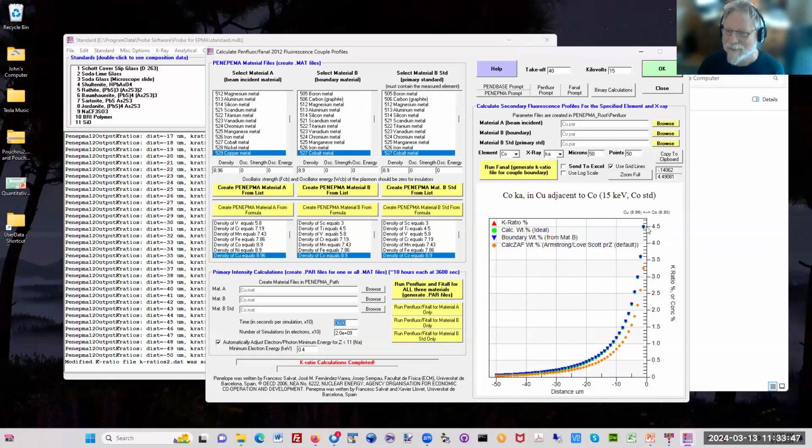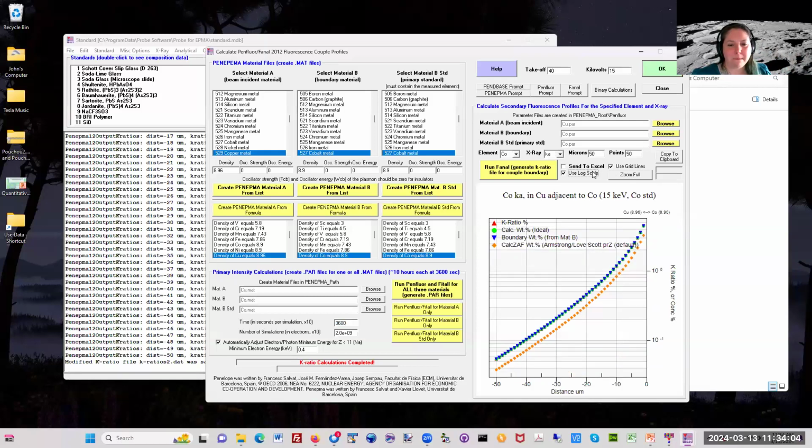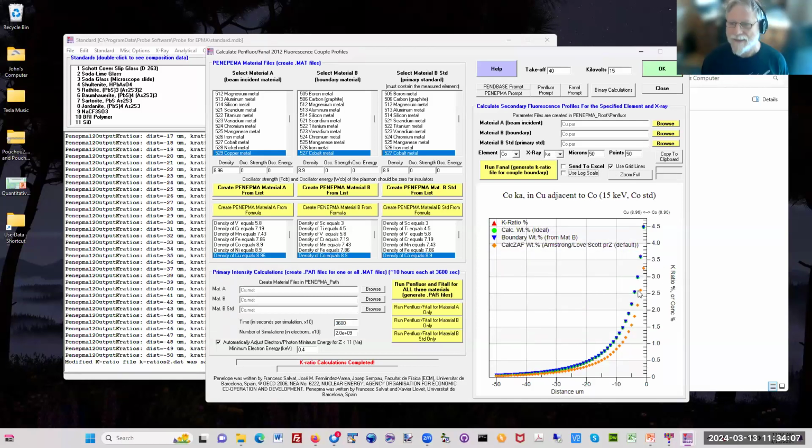We're going to get a signal of about 4.5 weight% of cobalt when we're 1 micron from copper. You can see it goes down to about 2%, and about 1% at 10 microns, and it keeps going. If you plot this on a log scale, you can see it just keeps going. A group at Oak Ridge National Lab contacted me because they were analyzing zinc in magnesium aluminum alloys, and they were detecting zinc a millimeter away from the boundary, and they were wondering what was going on.